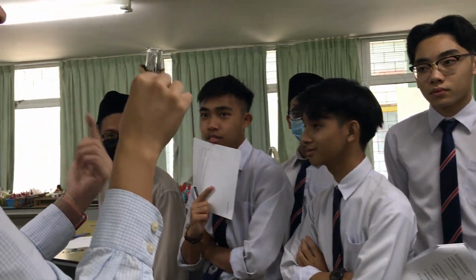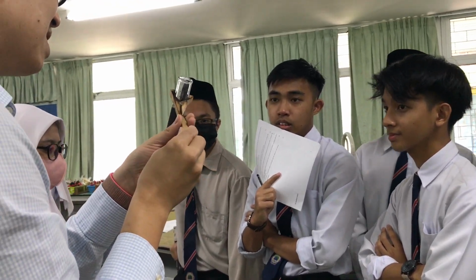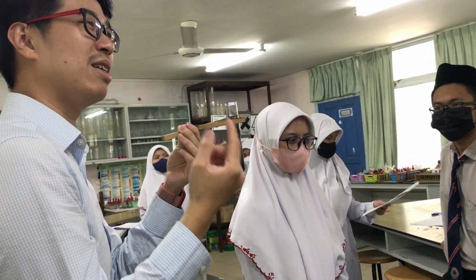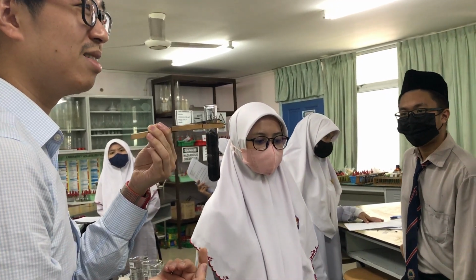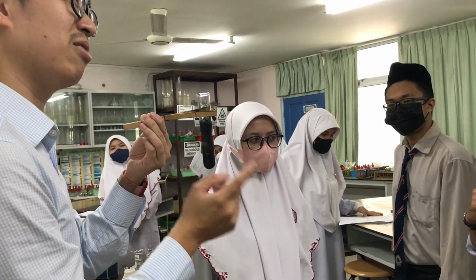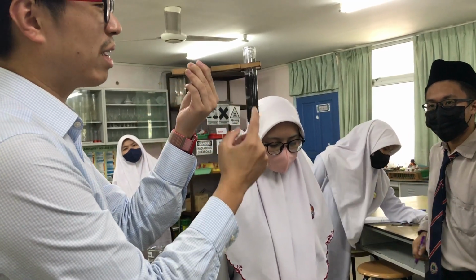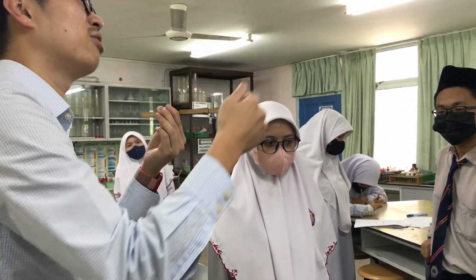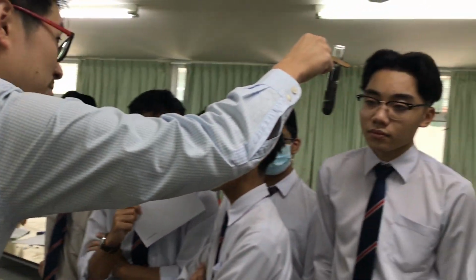Do you use up the catalyst at all? Hello everyone. Do you use up catalyst? Does catalyst react? No. It only speeds up reaction. If it doesn't react, is it used up? It doesn't react. So will you get the exact same amount as what you started with? Yes, because it only makes your reaction go faster. You see the bubble? Yes.